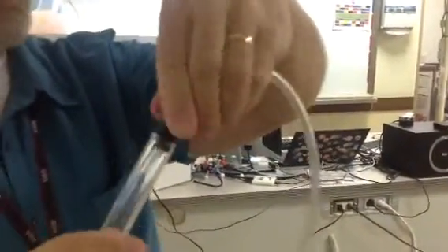I'm going to take this stopper with a glass tube. Let's get up close and personal. The stopper has a glass tube that goes through it that's hooked up to a long, flexible plastic tube, right? The stopper happens to be one which will fit snugly in one of the test tubes that's provided, forming an airtight seal, right?